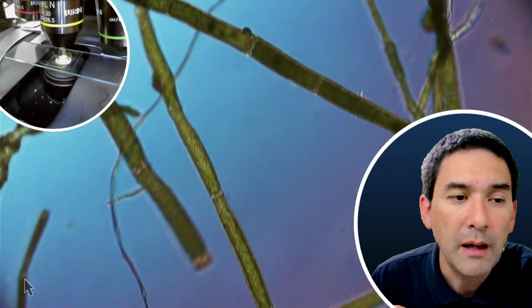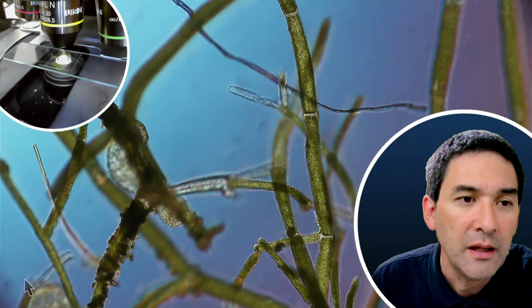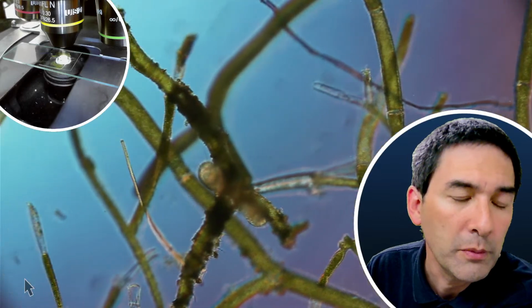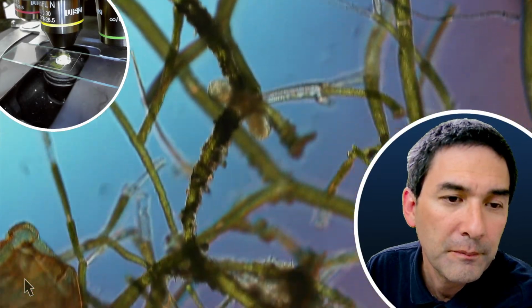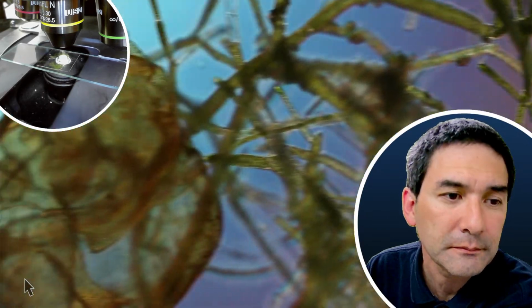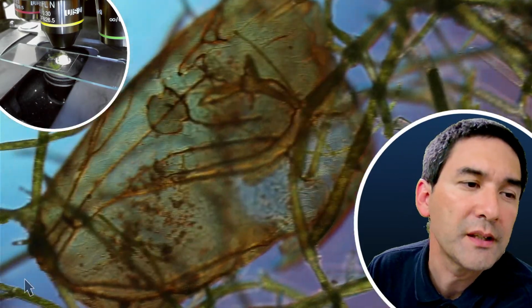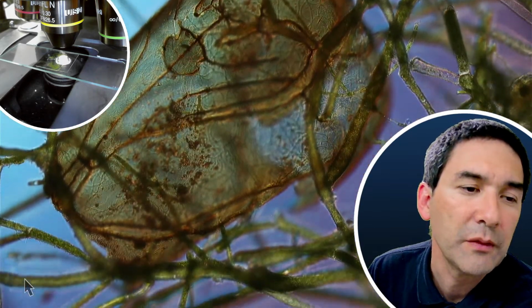I've not seen it here. For example, tiny mites are again more related to the spiders. What is this here? This here is a pretty short worm. So maybe this was also chopped in half. And this here definitely looks very much like the exoskeleton of some kind of an insect.